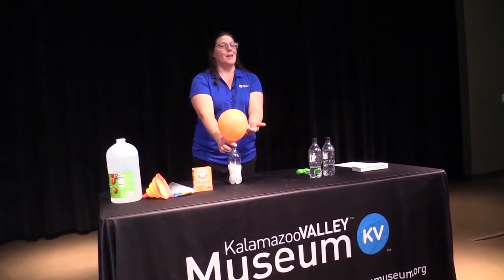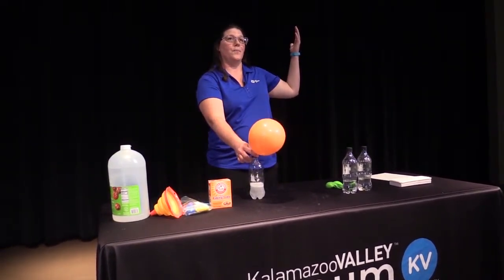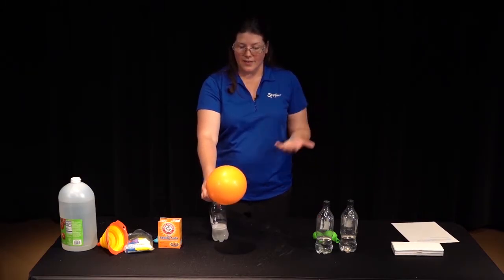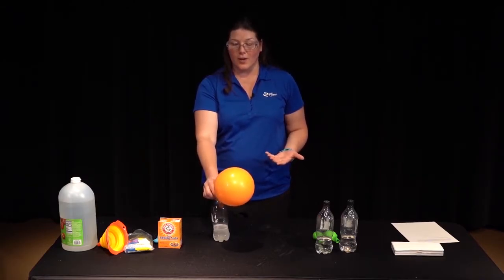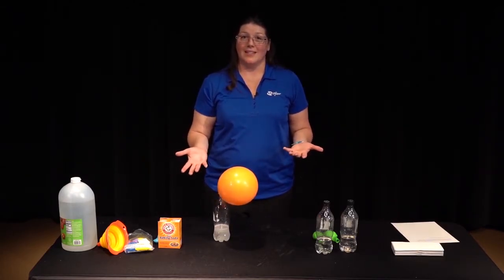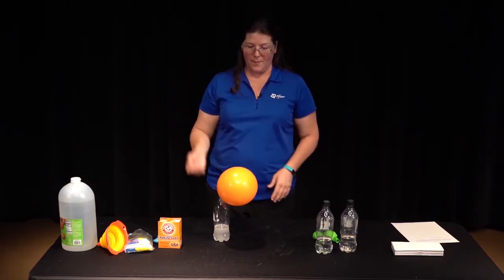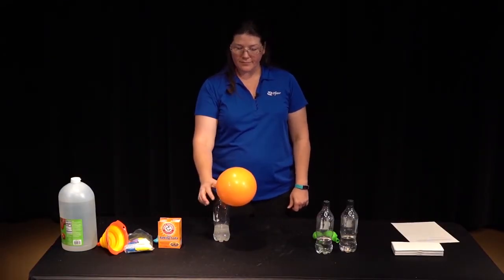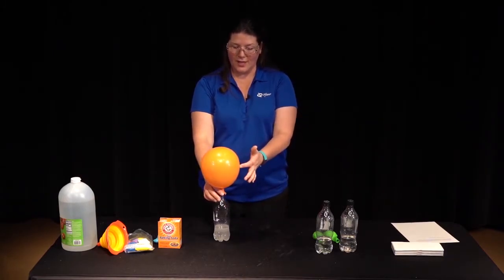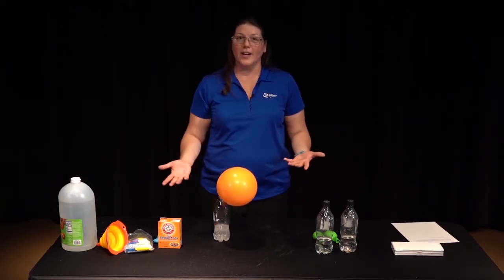Now this balloon isn't the same kind of balloon as a hot air balloon or a balloon that you would see at the store that floats on its own. Hot air balloons use heat. This is a chemical reaction to create gas. Very different. And helium balloons that you get at the store, those have helium gas in them. That's a very special gas that's very light, and that helps carry the balloon forward. This gas, even though it's light, it's not that light. It doesn't raise up. You can see our balloon's kind of down a little bit. But it filled up. This captured the gas. You can see the reaction still going down there, but it was very quick.